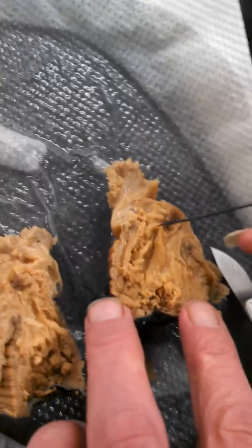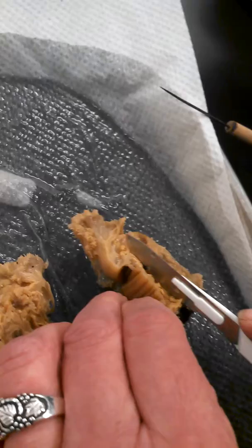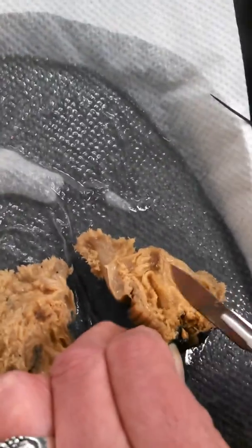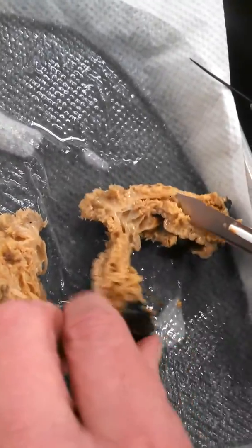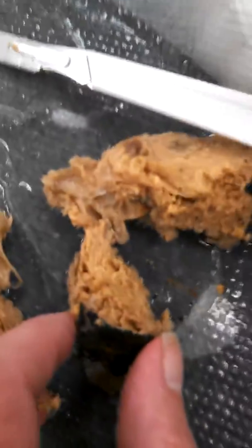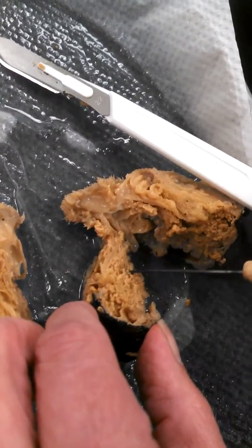Now, what's this bit about an oral ostium? That should be along the side here. What happens if we cut him again, but this way? Let's see what happens. Ooh, he's squishy. Very squishy. I guess this part here is the bottom of the oral disc and the start of the siphonoglyph.